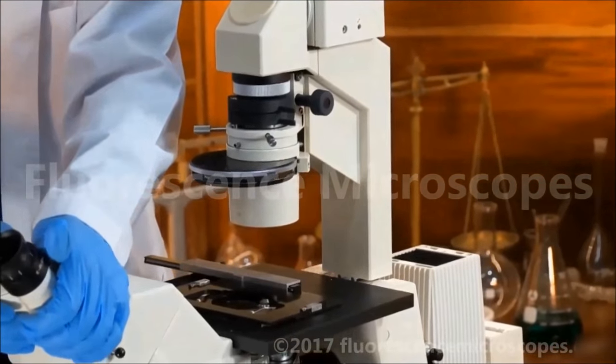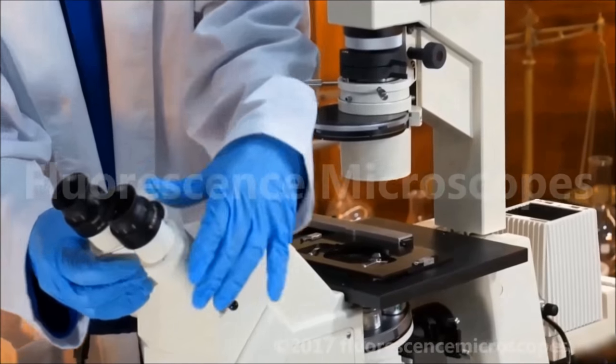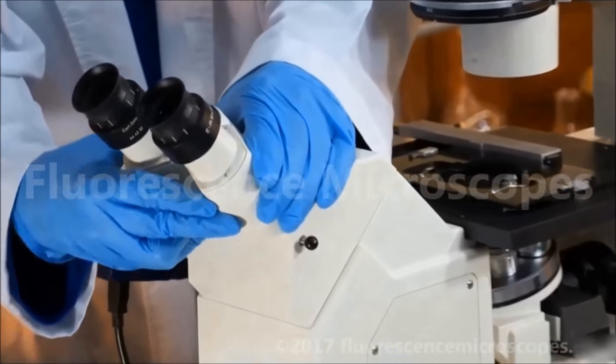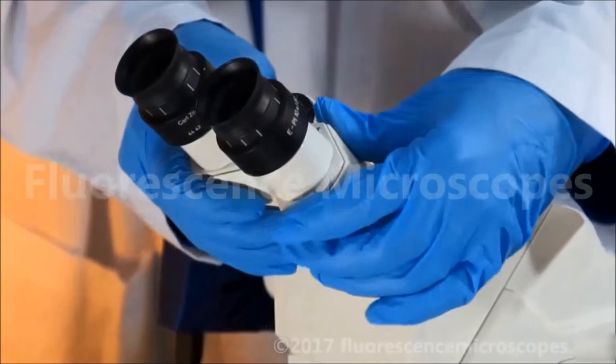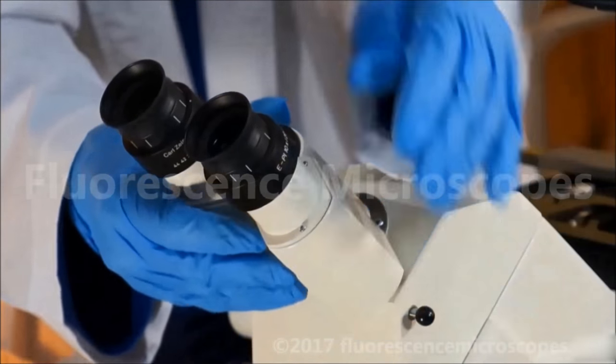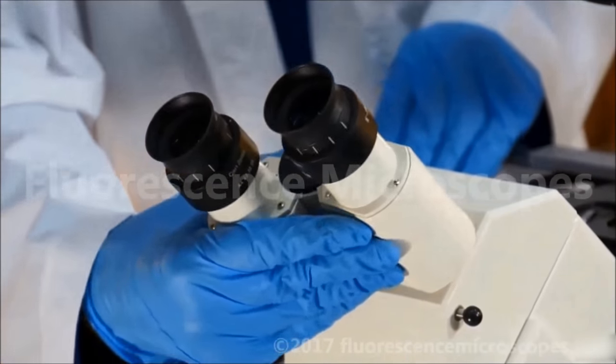The interpupillary distance, that's the distance between your eyes, can be adjusted. You just simply turn these oculars. You can also rotate this.